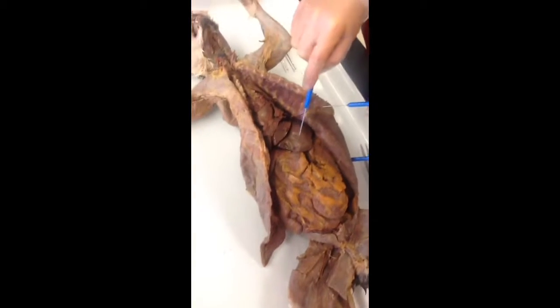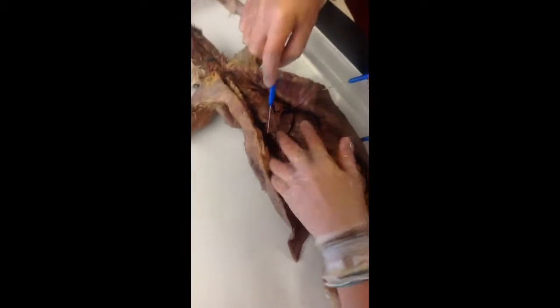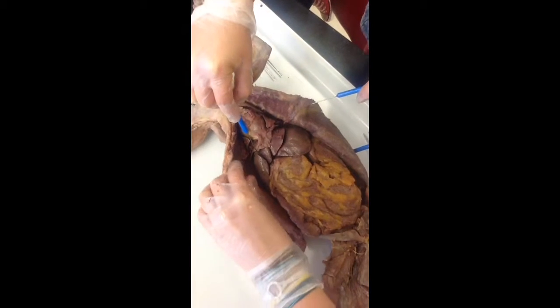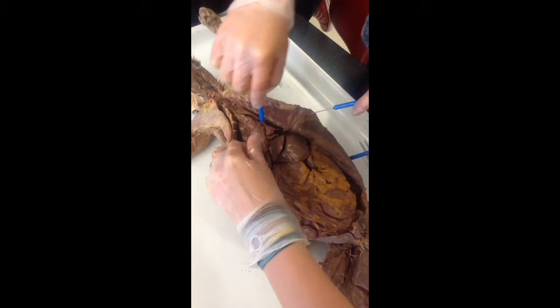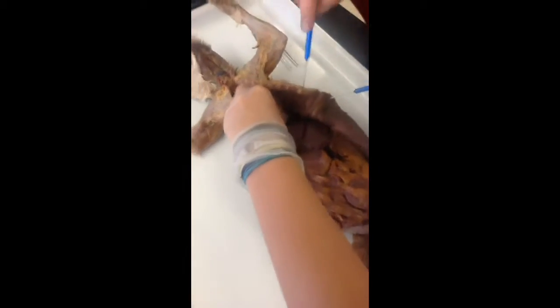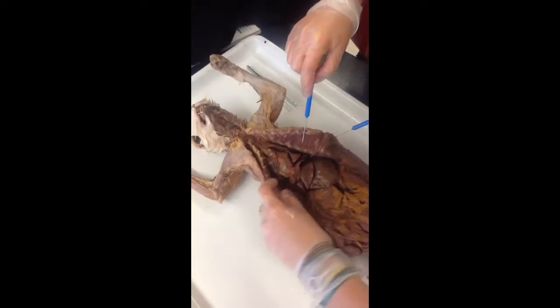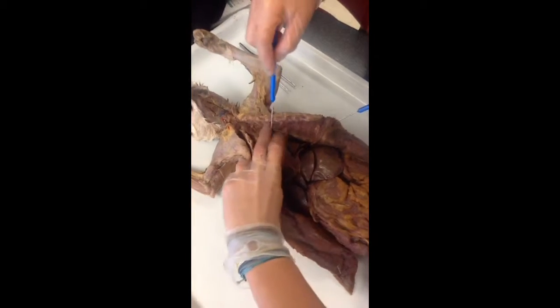So all this stuff is liver. Wait, what do you mean all this stuff? It's anything here. They're all liver. And this is the gallbladder right here. Where's the diaphragm? The diaphragm broke. It's all this though, right? Oh yeah. So if you were to pin it, it would be like here, or there's some other ones. But see it's a little bit better on top of the liver. Yeah. Okay. So what are these then?